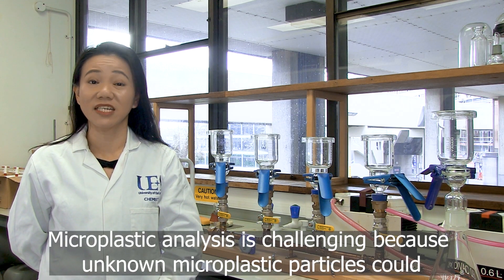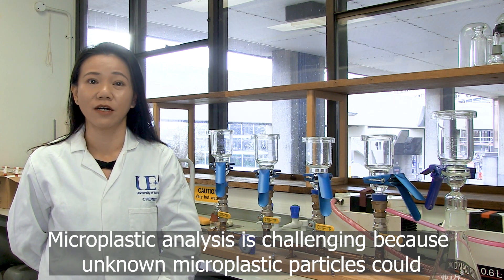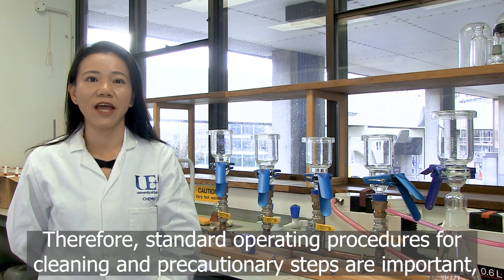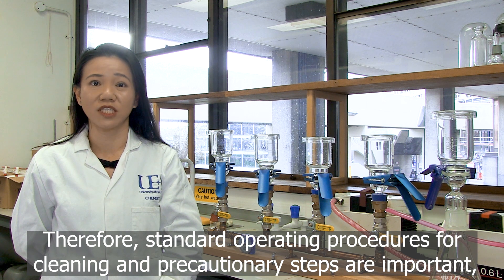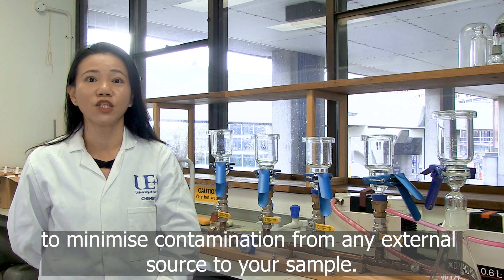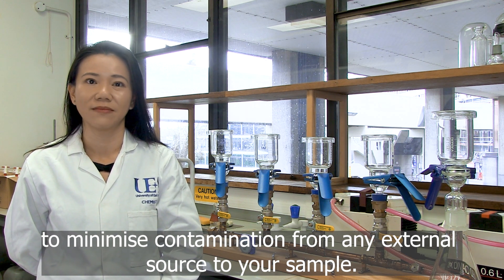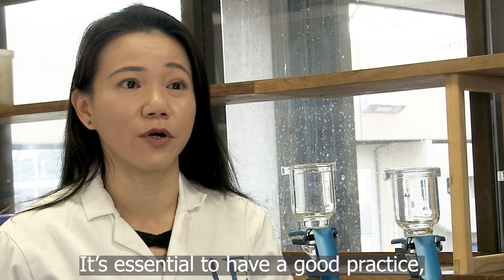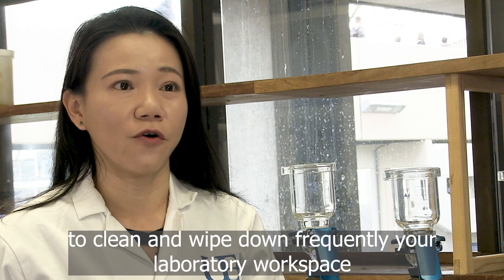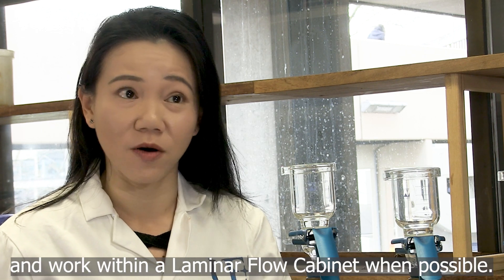Microplastic analysis is challenging because unknown microplastic particles could be everywhere — for example, airborne fibres. Therefore, standard operating procedures of cleaning and precaution steps are important to minimise contamination from any external source to your sample. It is essential to have good practice to clean and wipe down your laboratory workspace frequently, and to work within a laminar flow cabinet when possible.